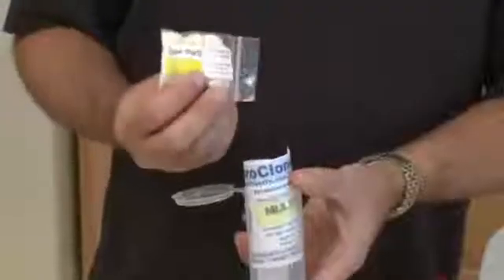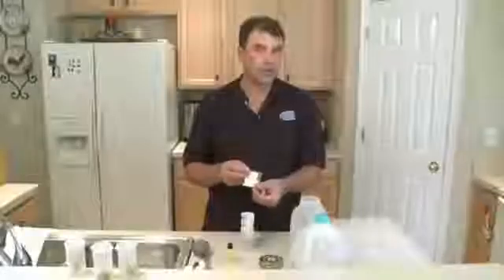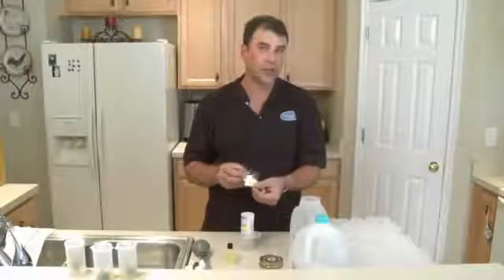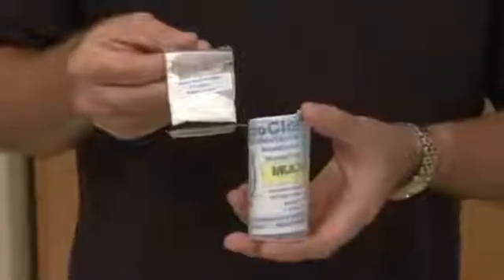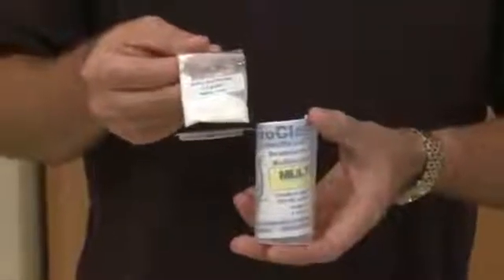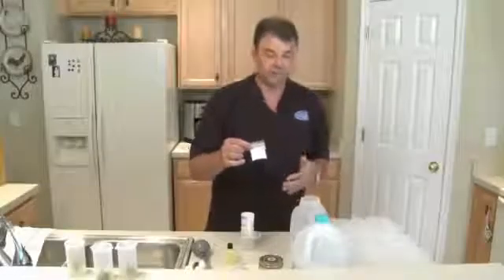The vitamins and the nutrients are all in this powder right here, all pre-measured. The entire contents are going to go together into this one liter, and lastly will be the gel powder. And again, the entire contents are going to go in. This is one liter of finished medium.